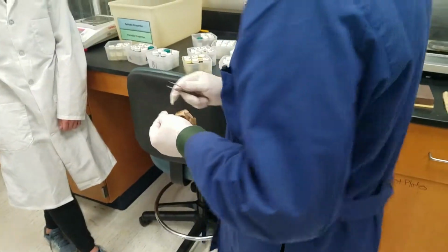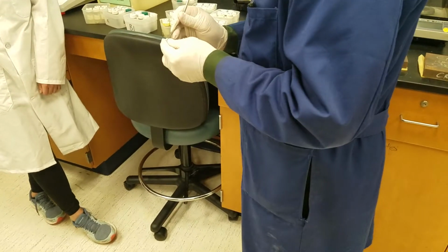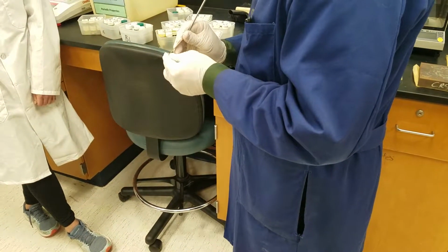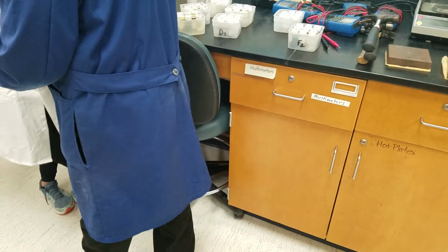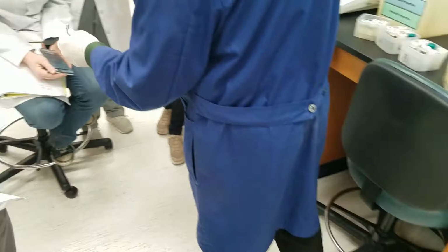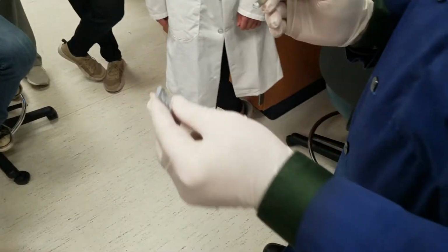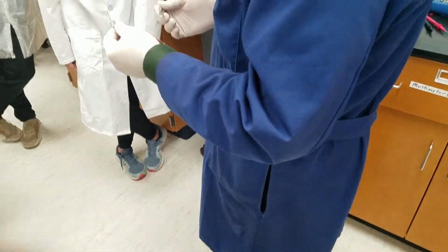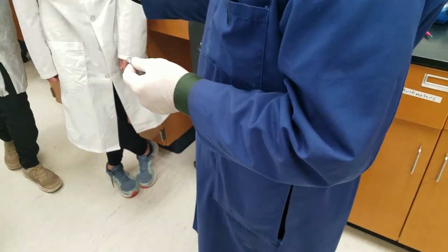and so as your number of valence electrons increase, your metallic bonding increases. So if I cut it, you see that you've got your metal luster, but here even more quickly it fades. And so here, Ben, why don't you toss this in the next one?